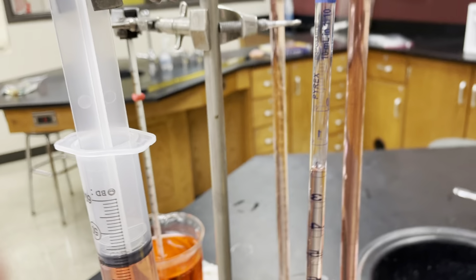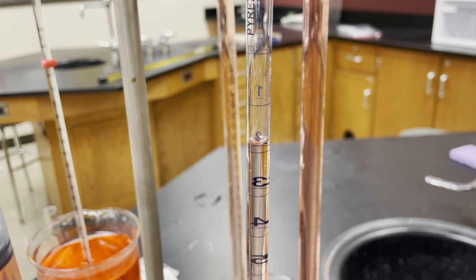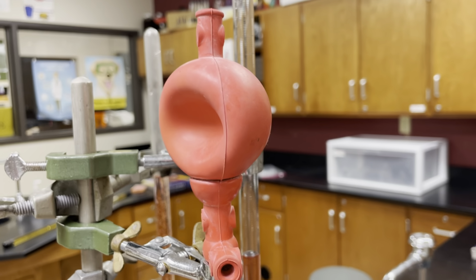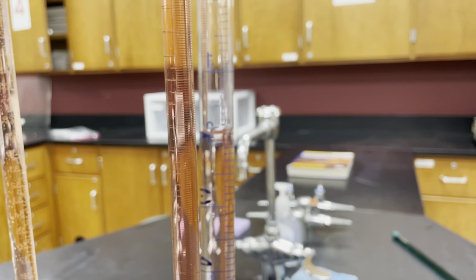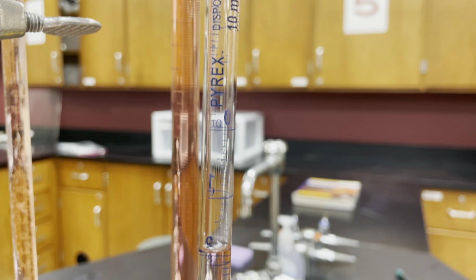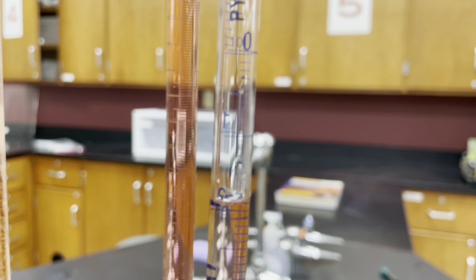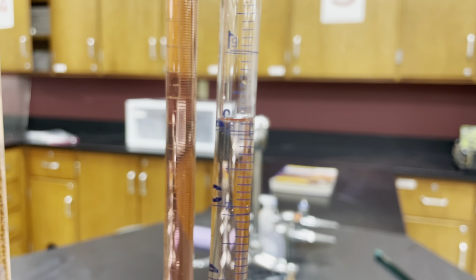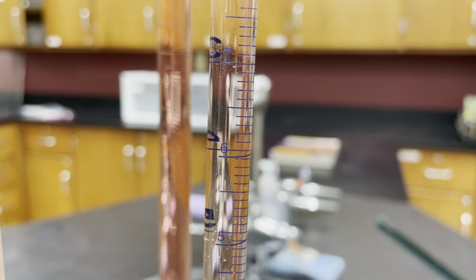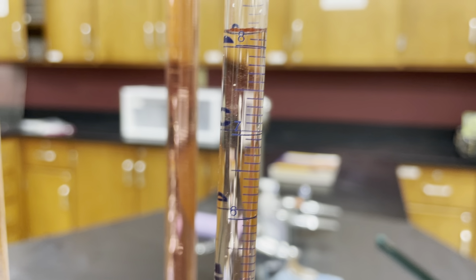Let's go over to a versatile piece of glassware, which is this guy right here. This is a serological pipette. A pipette is just something that's used to draw up liquid. There's a bulb up here at the top that's used to suck liquid up and also shoot it back out. The side that I have this facing on right now has some very small, tiny numbers. Like there's a 10 right there, a 9, an 8, a 7, and a 6. That came out nice and clear.